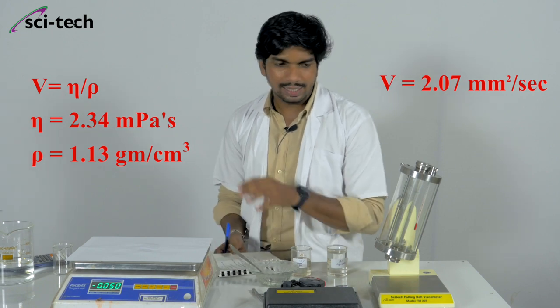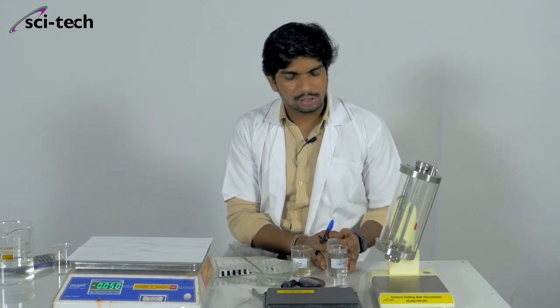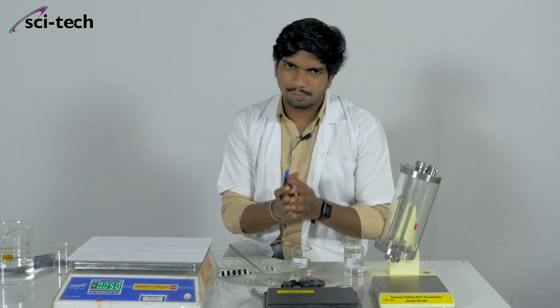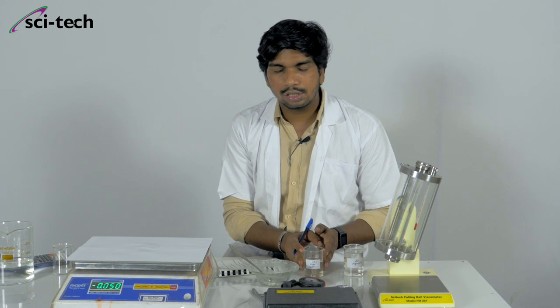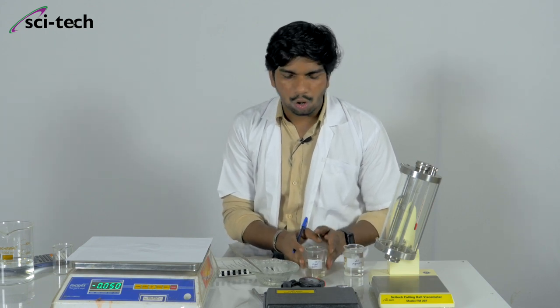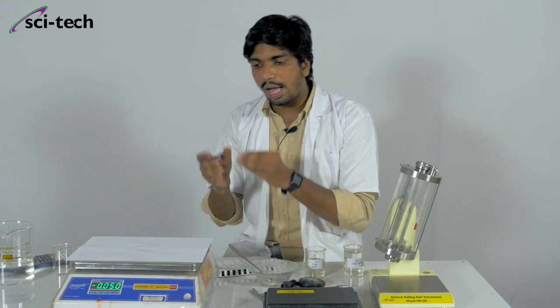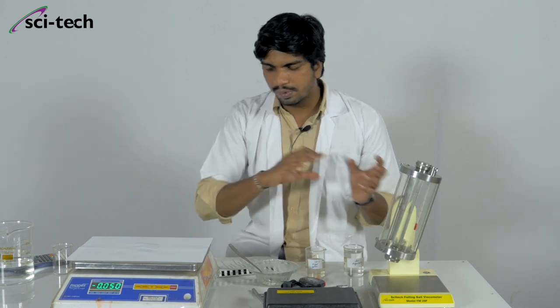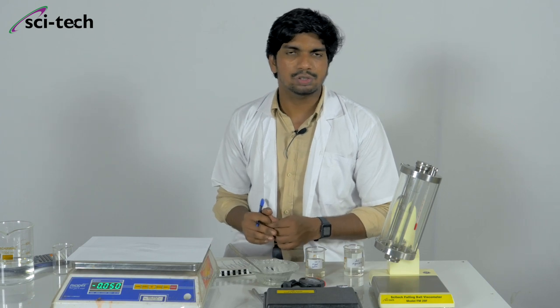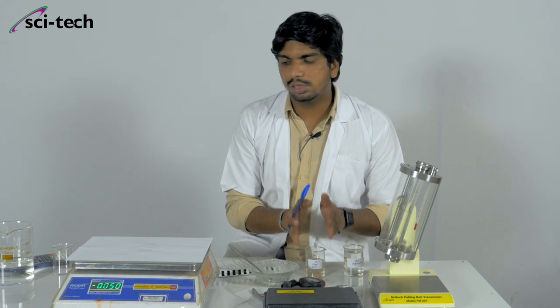Using this data and equipment we have calculated the dynamic and kinematic viscosity of the sugar solution. In the same way, if you have any kind of Newtonian fluid — such as oil, vegetable oil, kerosene, petrol, diesel, sugar solution, or glucose-fructose solution — you make the solution with the weighing scale, calculate the density, pour it into the glass tube, and apply the mathematical formula to get dynamic and kinematic viscosity.